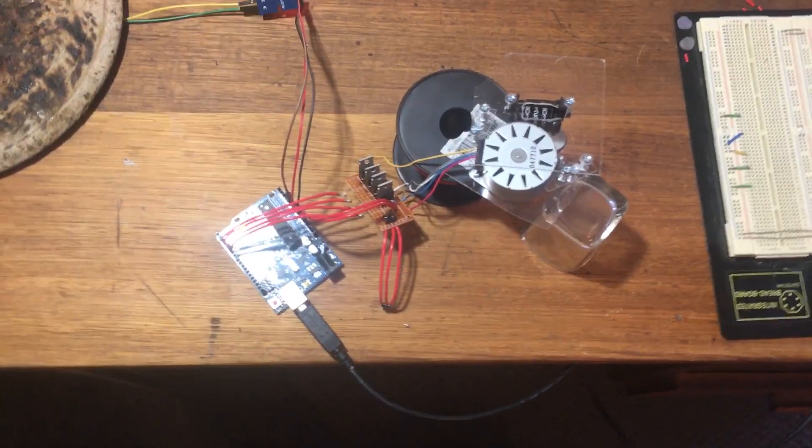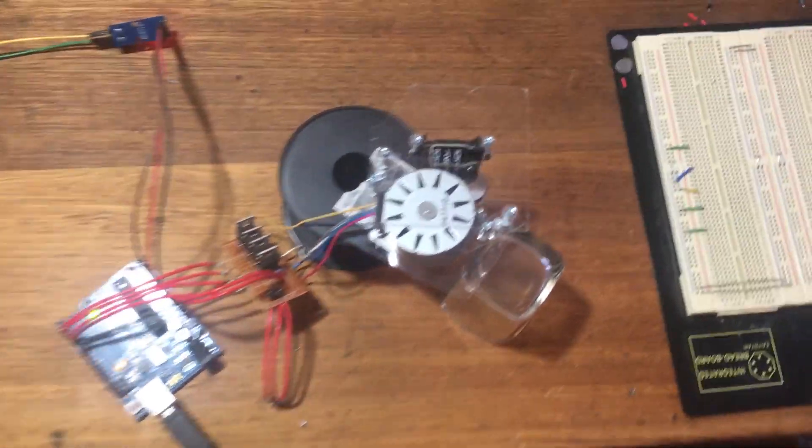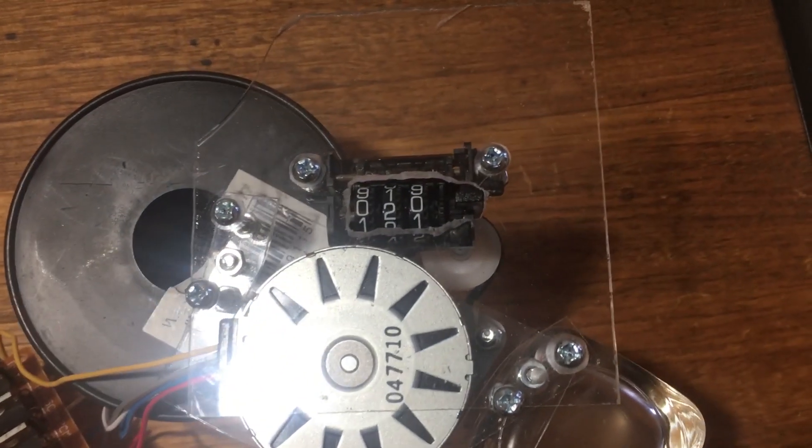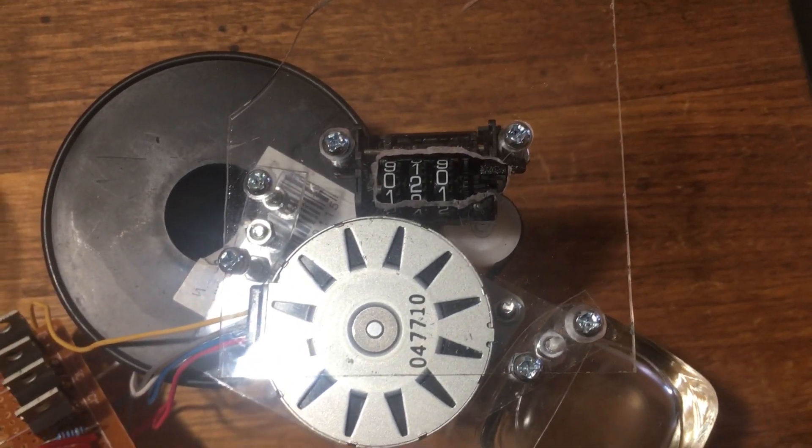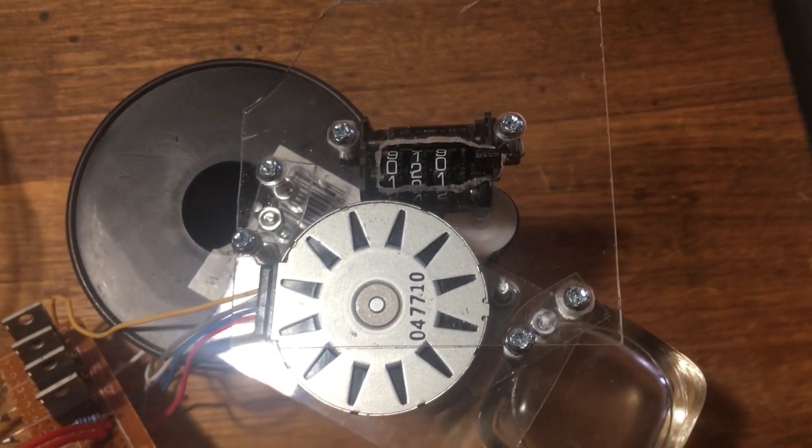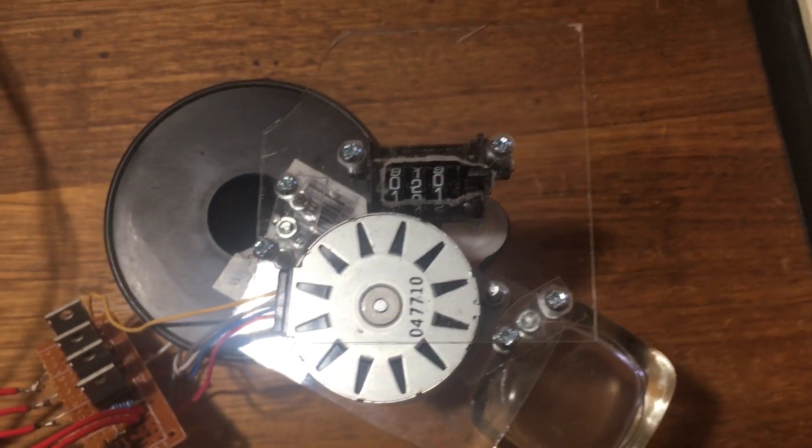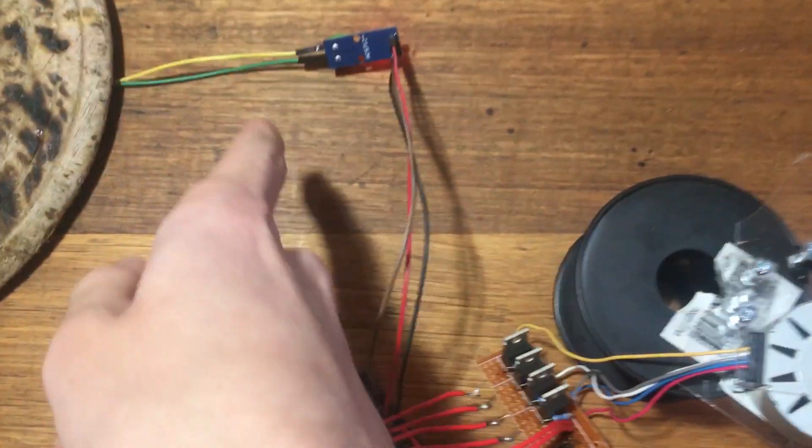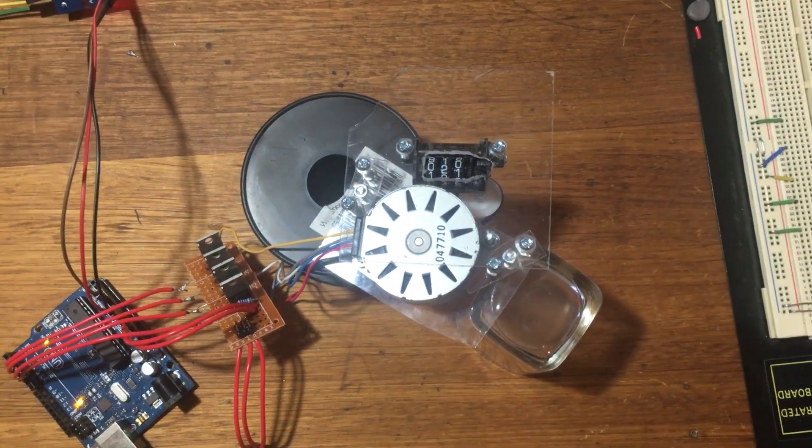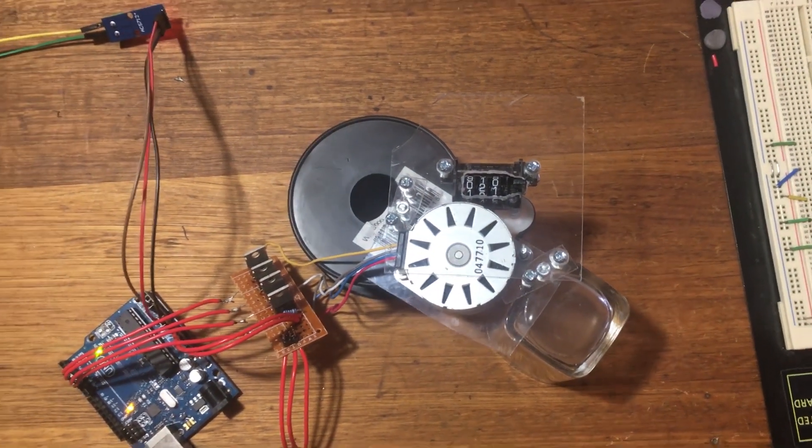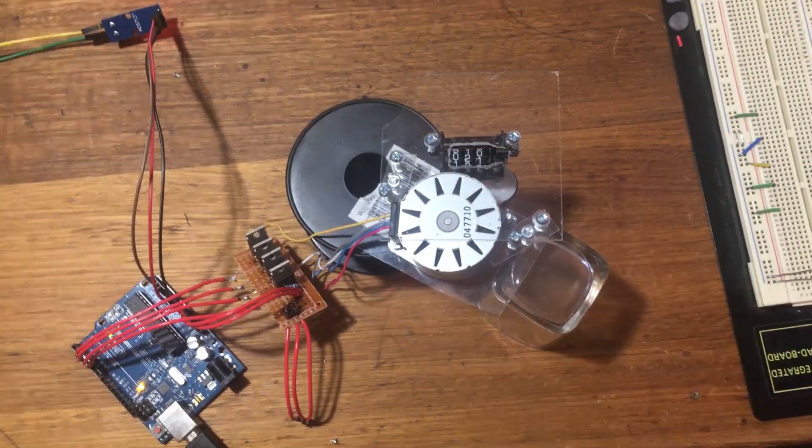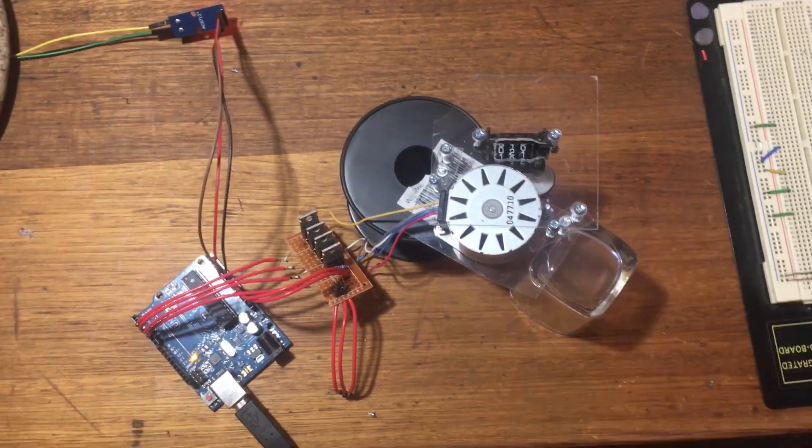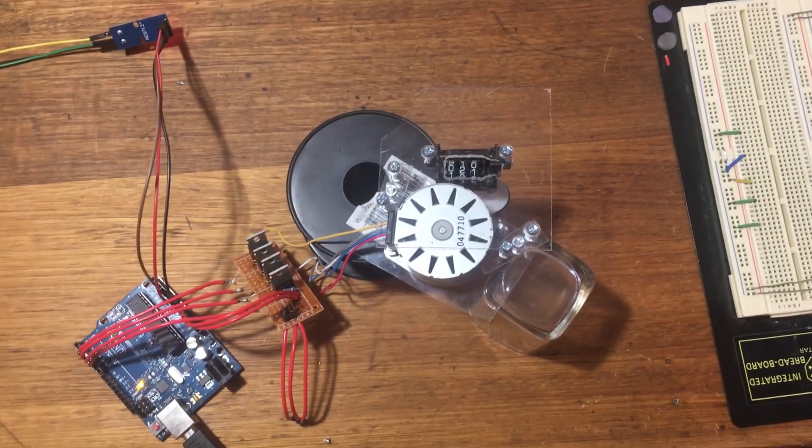And 32 minutes on, we see pretty much exactly what we want to see. That's a little bit over 20 millimoles of electrons. Perfectly accurate enough for rough estimates that we want to be using in future electrolysis runs.